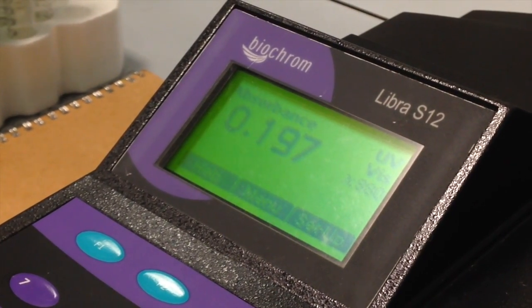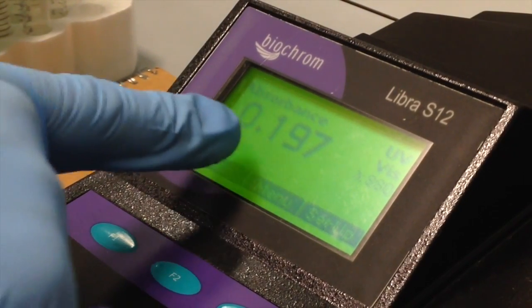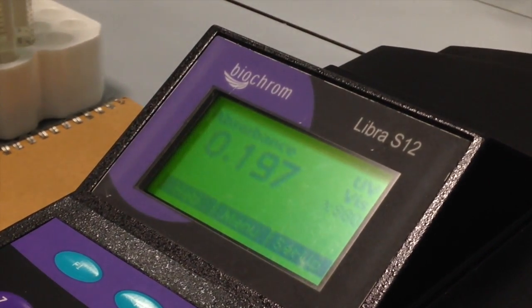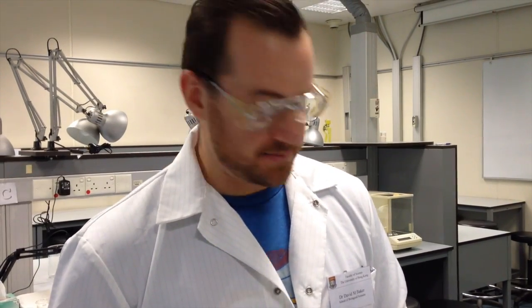So in my lab notebook or on my worksheet, I'll record this absorbance 0.197 as the absorbance value for the first standard of 100 micrograms per liter. And you will repeat this process for each of the standards as you complete the exercise. Once you have the standard curve values, you will input them into a computer, and you'll use the equation of the line from that computer to calculate the concentration of your unknown based on its absorbance.